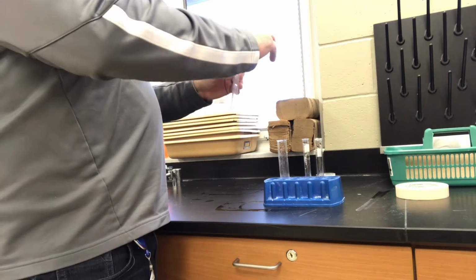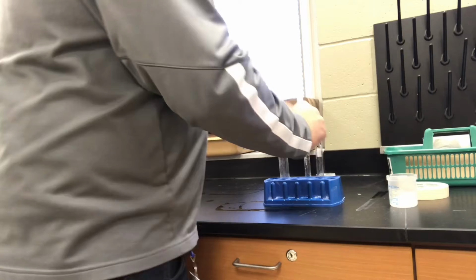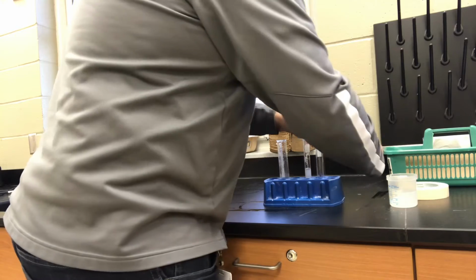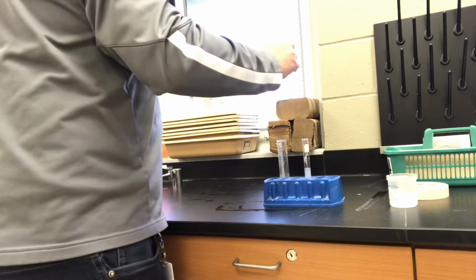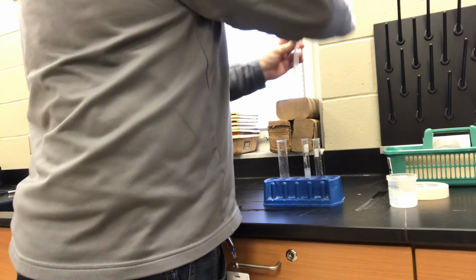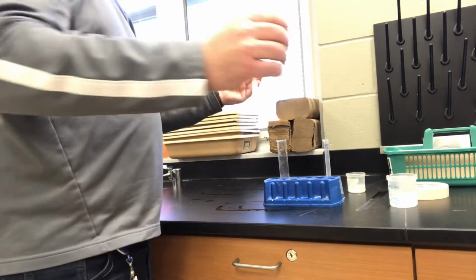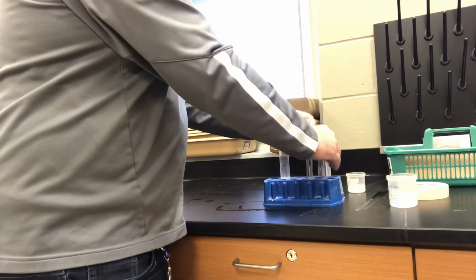We're going to take 10 milliliters of the calcium chloride, and there is 10 mils in that test tube. And we're going to take 10 mils of the baking soda. Whoops, I've got to measure it out first, don't I? We're going to take 10 mils, here we go. 10 mils of the aqueous solution of the baking soda, and we're going to take both of those. So they're dissolved in these test tubes. I know it's kind of hard to see. And we are going to mix them together.